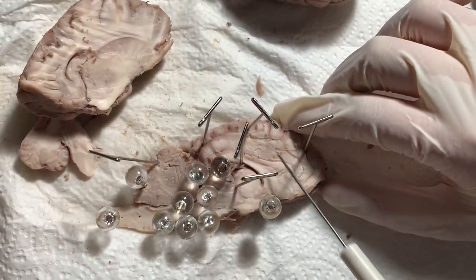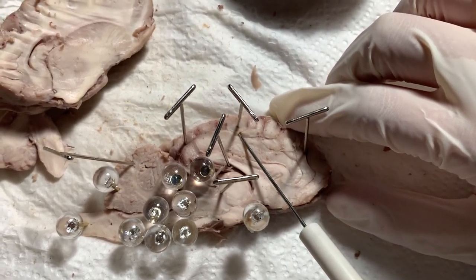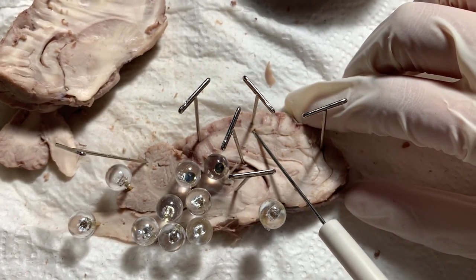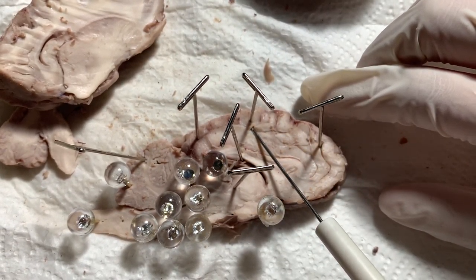Next we have the parietal lobe. The parietal lobe's objective is to deal with sensory information such as temperature, taste, and sensations related to touch.